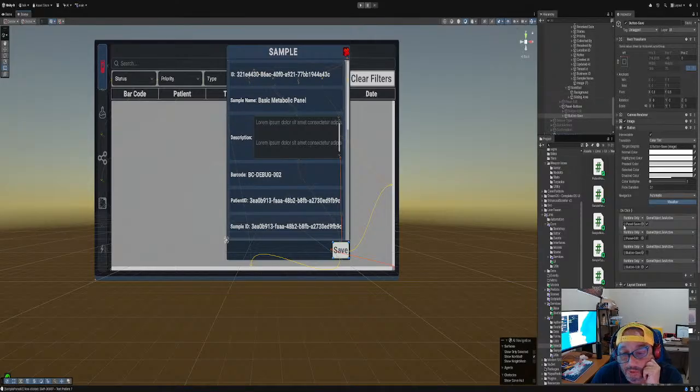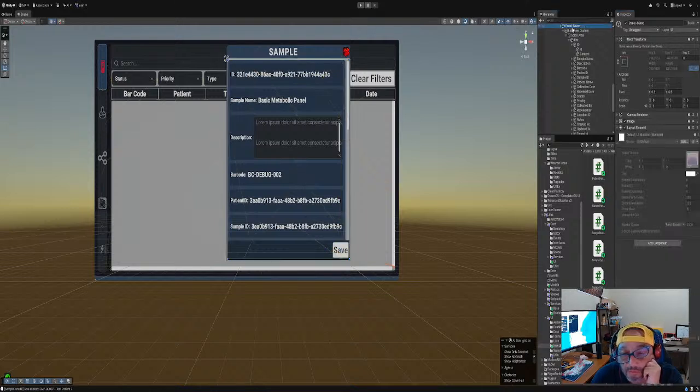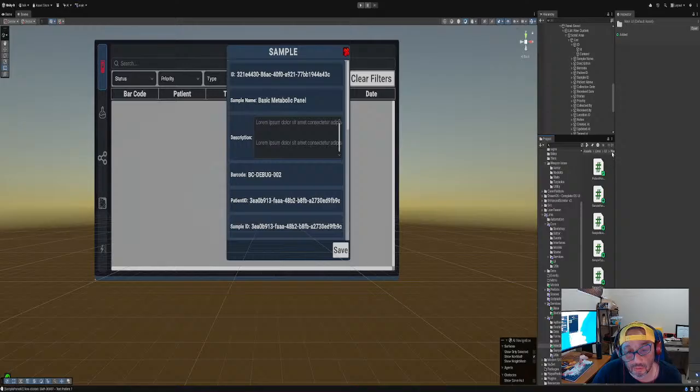And that is supposed to go from, oh, here goes the actual script. No, there's no script for it. That's weird, I thought I did a script for it. All right, so what we're gonna do is write a script for just this one. I'm gonna call it display sample UI.